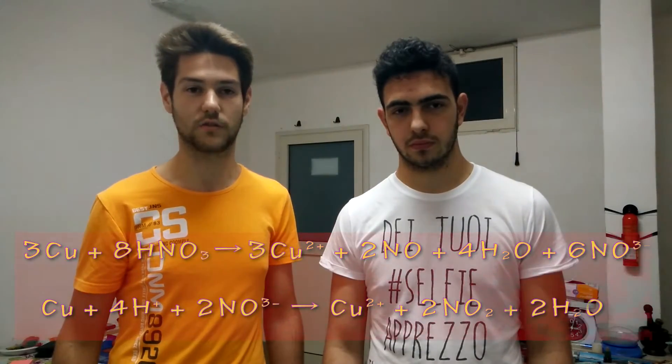Then what we are going to do is take the nitric acid that we produced and put some pure copper in it, and we are going to observe a reaction.